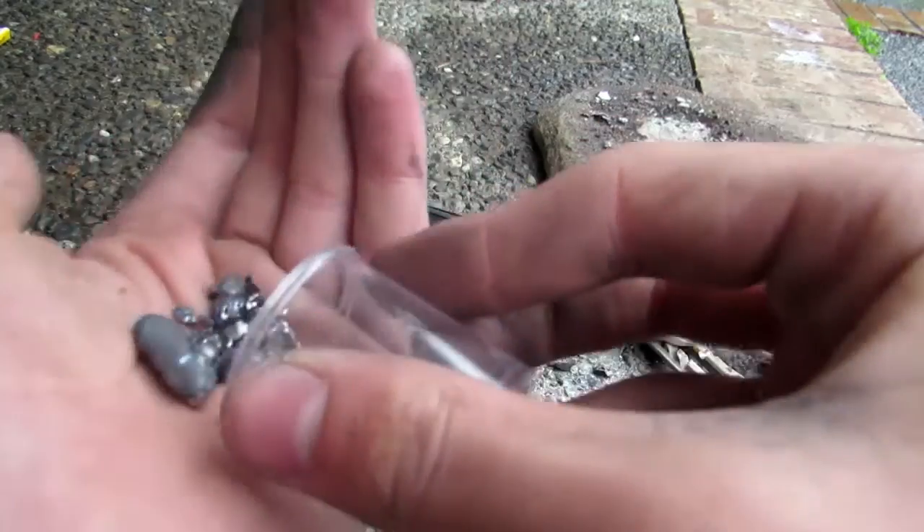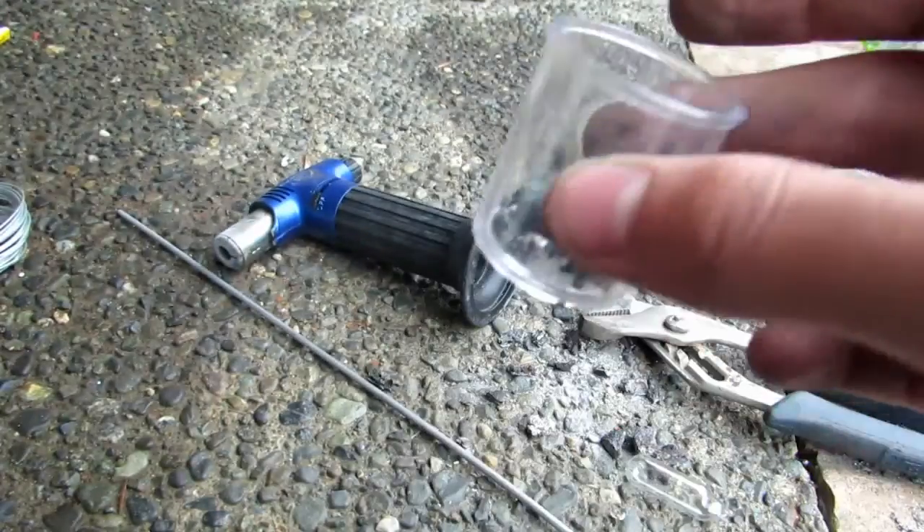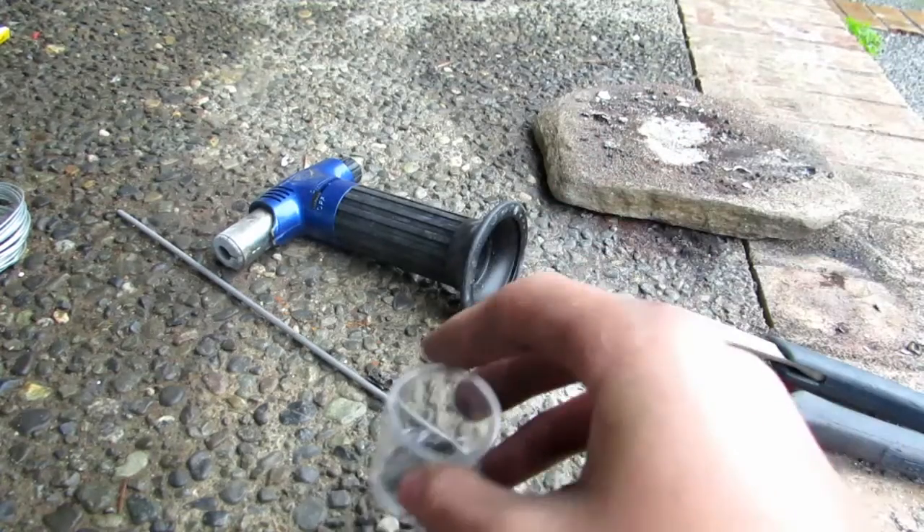There were some really, really beautiful beads here. This is definitely my new manganese collection. In a moment I'll take it inside and weigh it just to see how much we got.